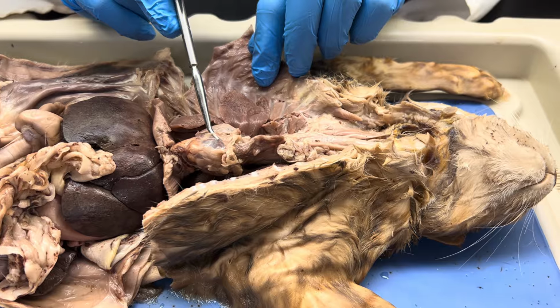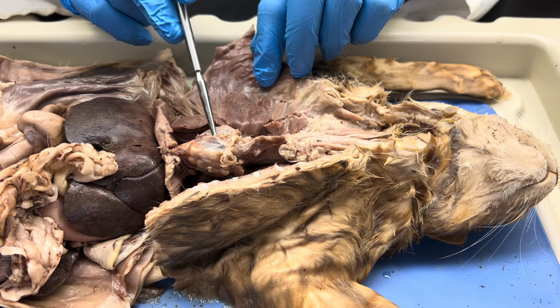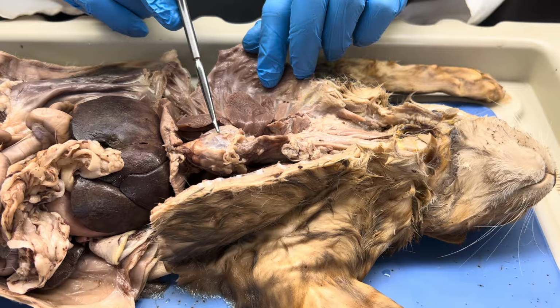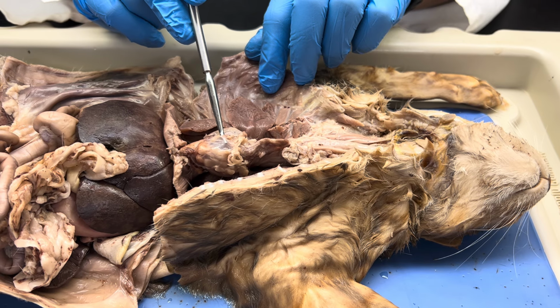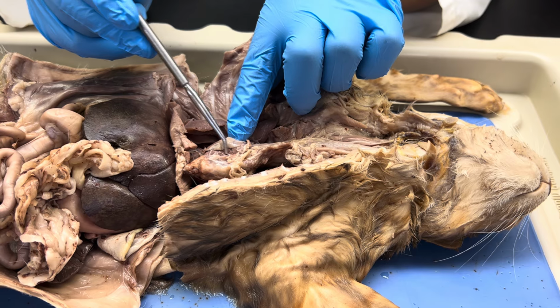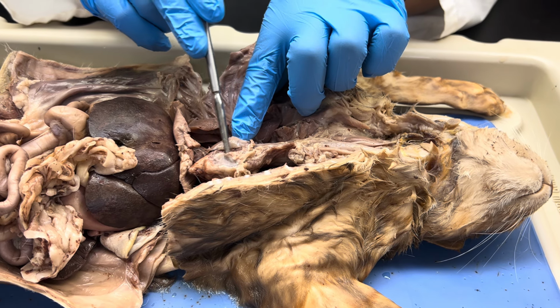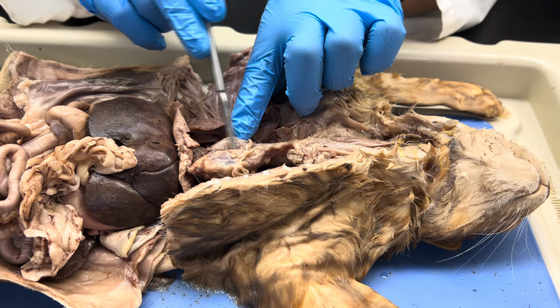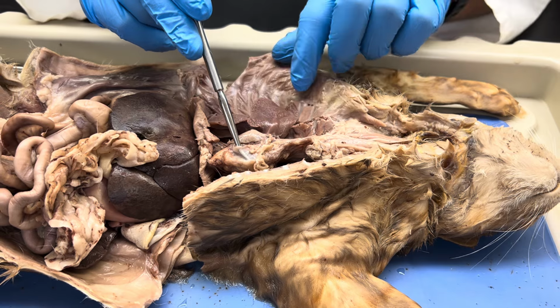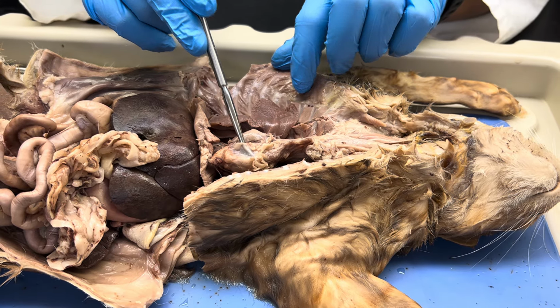Now for me, I do usually dissect this a little bit more, but I'm not gonna do it because this is probably somebody else's dissection. I don't wanna intrude on their work. But I'm lifting the parietal pericardium. Again, the serous pericardium would be on the surface of the heart. The space where my probe is right now, that is the pericardial cavity, literally that space. It's between the two layers, all right? So again, we're referring back to that concept from A&P1. So that's the pericardial cavity.